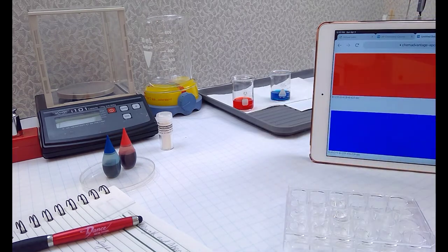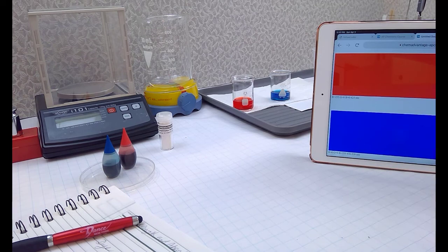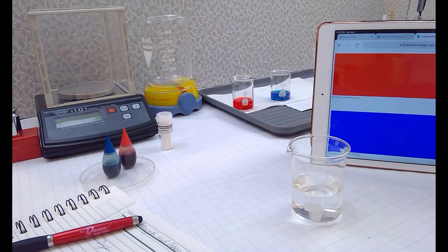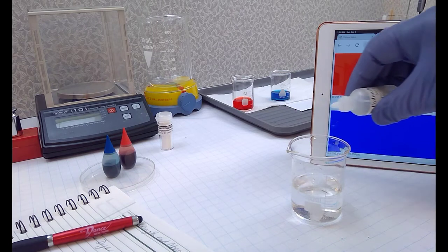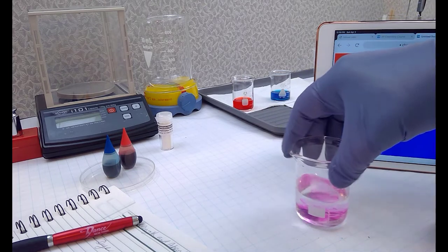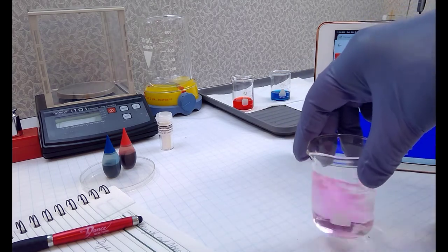So what I'm going to do next is what phenolphthalein is most famous for. That is, it's famous for being able to turn a beautiful color when it's in a basic solution. I'm going to add some sodium hydroxide to this beaker, which has some phenolphthalein in it. You'll see the infamous and beautiful magenta that's produced when you have a basic solution.